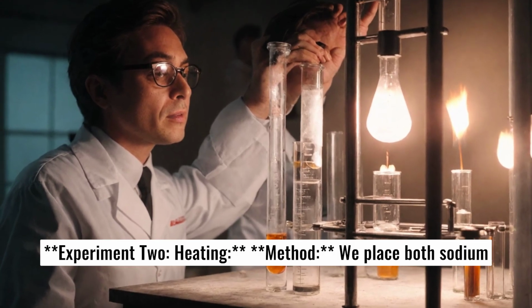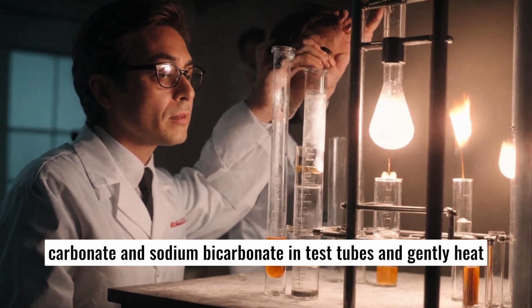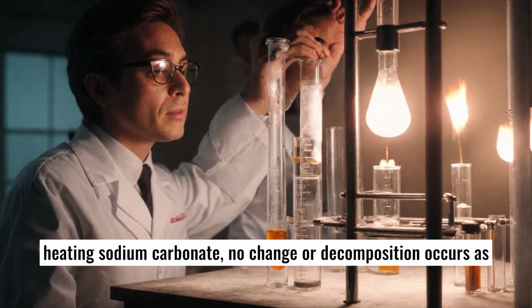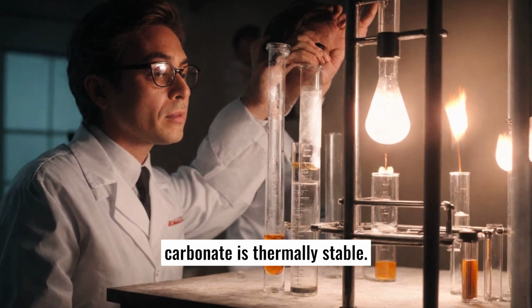Experiment 2. Heating method. We place both sodium carbonate and sodium bicarbonate in test tubes and gently heat them using a Bunsen burner. Carbonate, CO3 2-. When heating sodium carbonate, no change or decomposition occurs as carbonate is thermally stable.